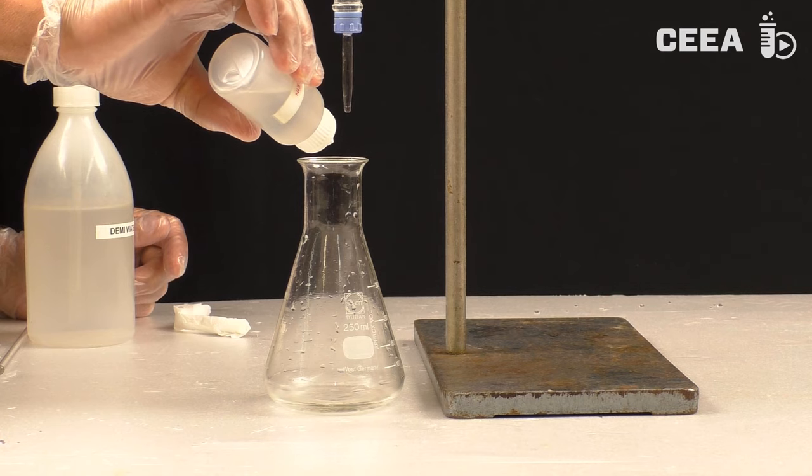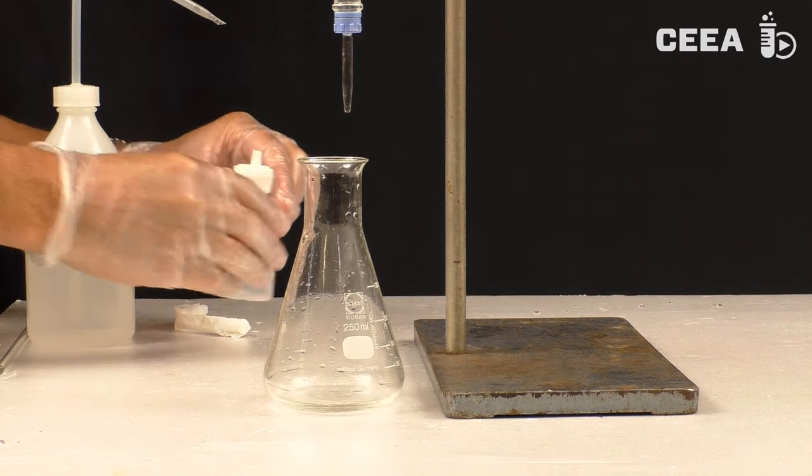Finally we add a few drops of indicator solution, in this case phenolphthalein.